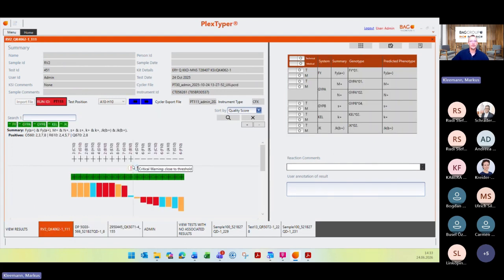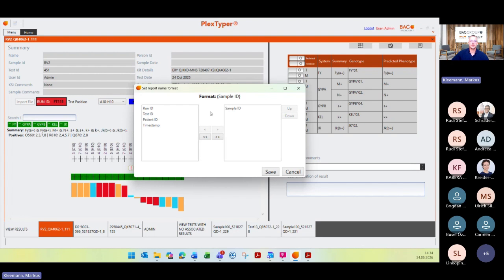I jump back to this sample here because I want to show you how to create different types of reports. When you create your report, you can set report file name formats. With this tool, you can change the name of the report. In my case, I just have the sample ID here, and then the report is saved after the sample ID. Or you can add, for example, the timestamp, and then the name of the report changes from only sample ID to sample ID, then this stripe, and then the timestamp.